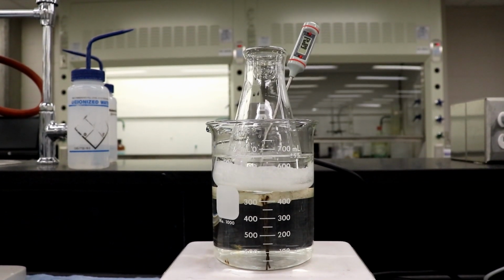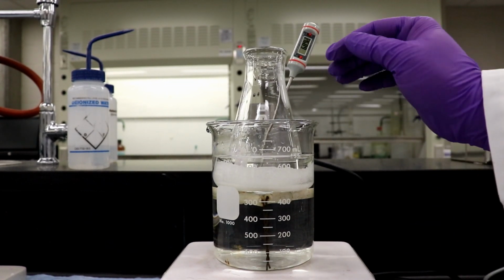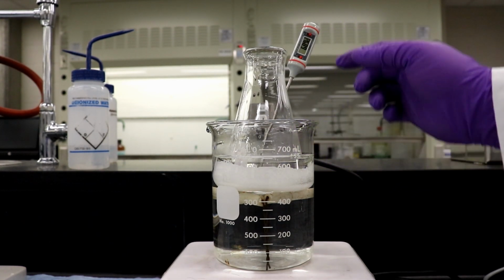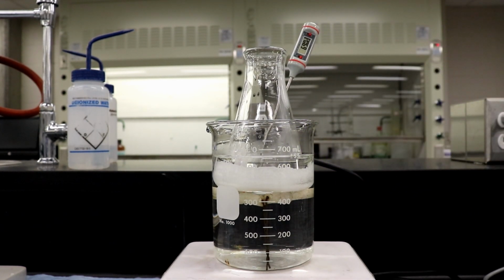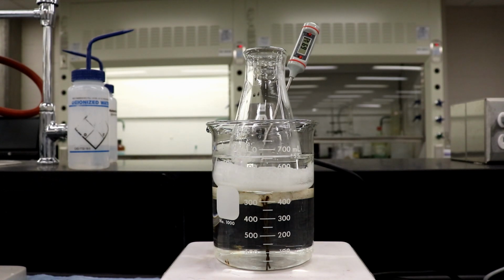Okay, so we're at 6 minutes and 33 seconds. Our temperature is 68.8 degrees Celsius. I've turned off the heat. I've been adding a little bit of DI water just to bring the heat down. And I might bring this off the hot plate pretty soon. But we're almost at 7 minutes, so it doesn't really matter anyways. We're at 650.